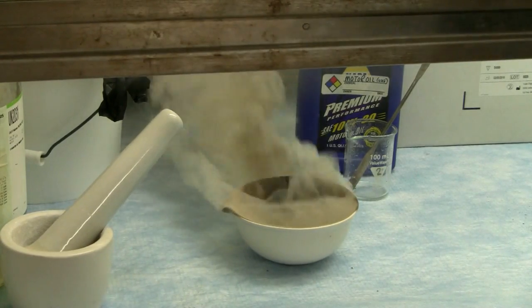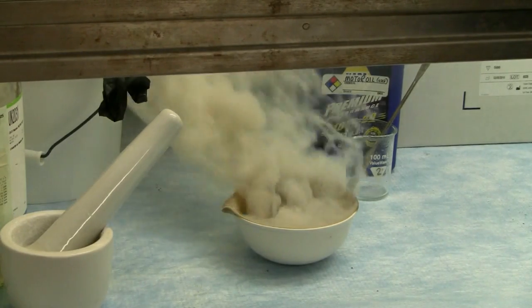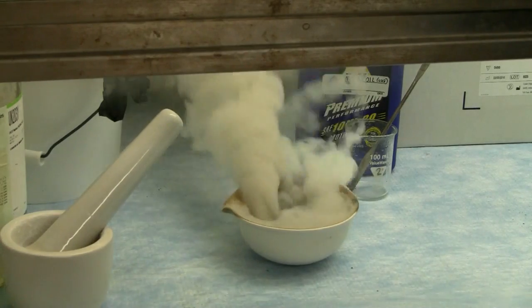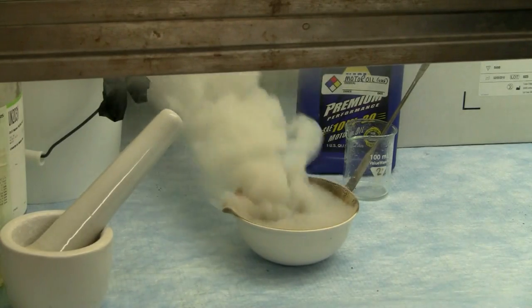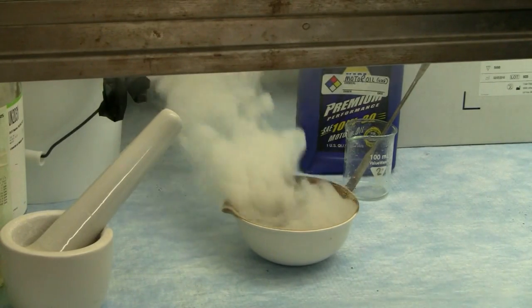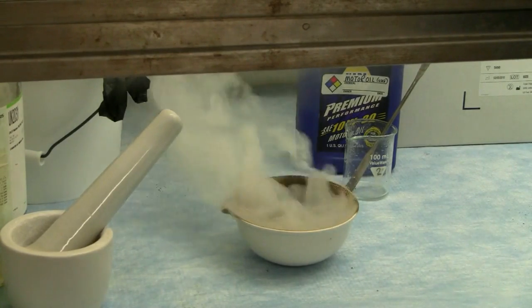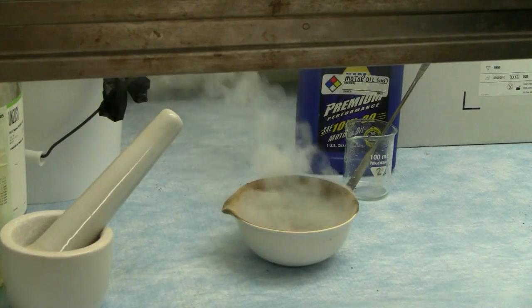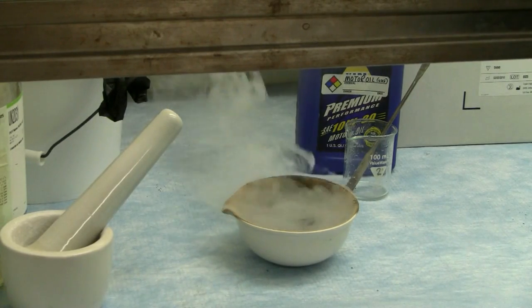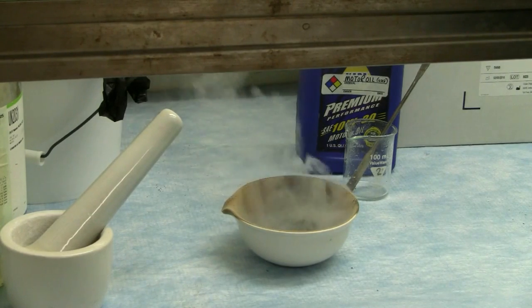Now, like I said, this is the motor oil and the pool shock. And as you can see, there's a great deal of gases liberated. Now, it's an incomplete combustion process, so you're getting not just carbon dioxide, but carbon monoxide, possibly some, you know, oil is not completely pure, so there's nitro groups and phosphorus groups, so you probably have phosgenes, some amines, other mixed chemicals in there. So it's a very vigorous reaction, although it takes a little while to get going, and it liberates a lot of toxic gases, and as you can see, quite a bit of gas at the same time.